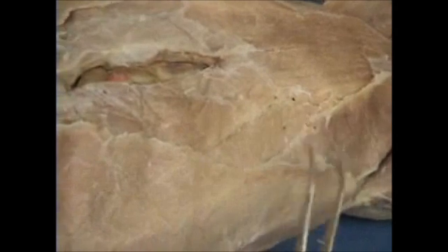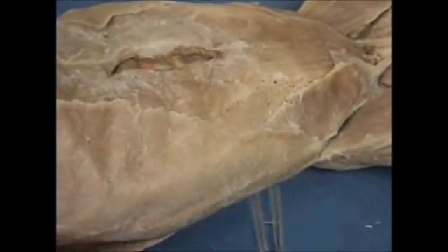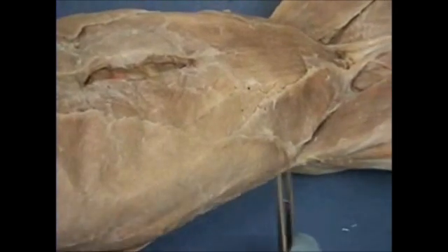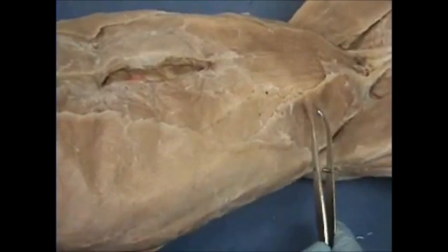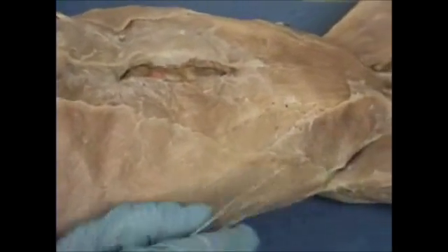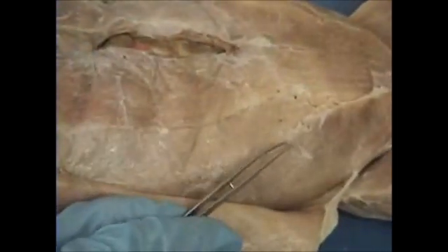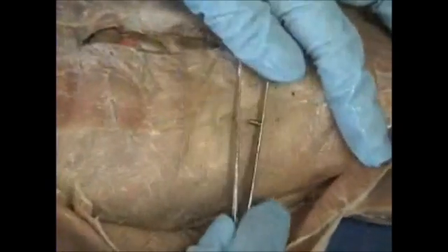Neither one of these muscles have to be dissected out in order to be asked. So they can have a pin here, external oblique. All this is your external oblique. And they can have a pin here. Name this muscle, internal oblique. Now, underneath your external oblique and somewhat under your internal oblique, you have muscles with striations running completely across from left side to the right side.